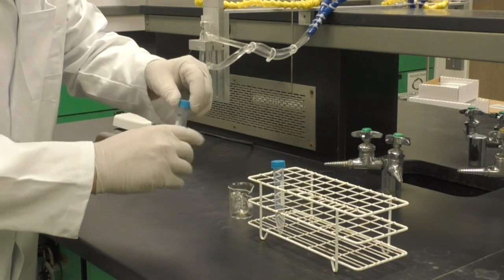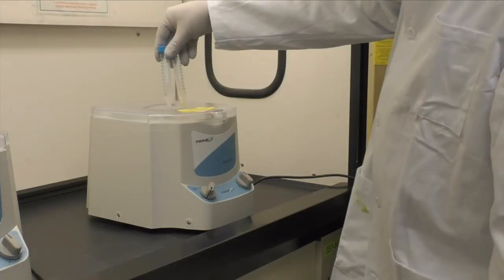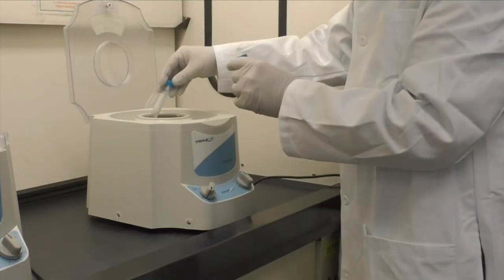Place your product into the centrifuge for 2 minutes. Make sure to have a balance tube and follow all the centrifuge directions.